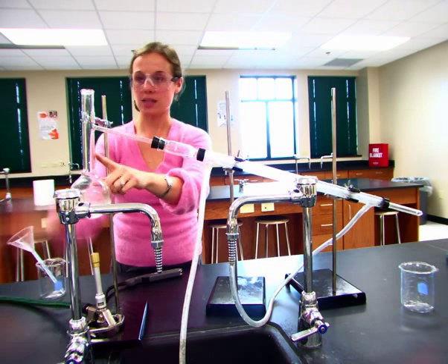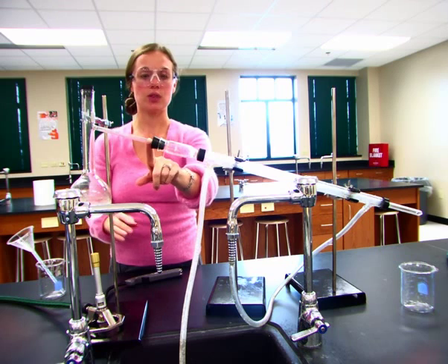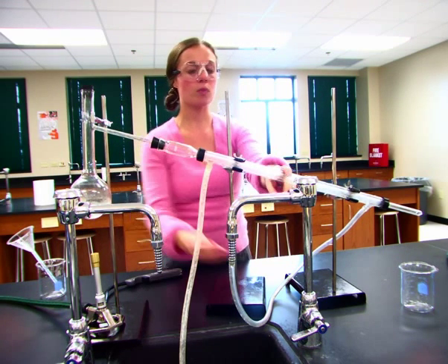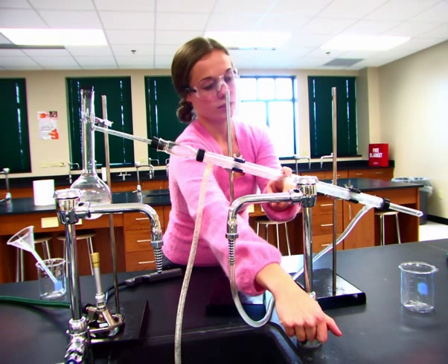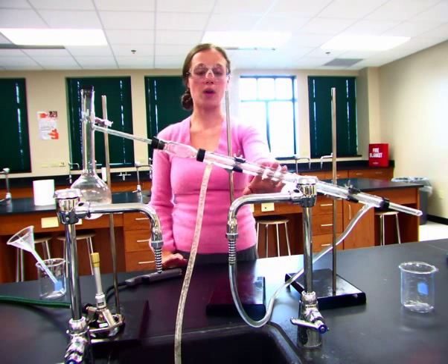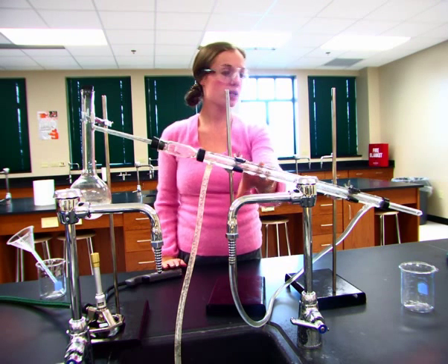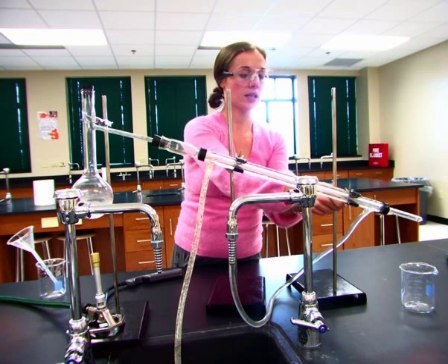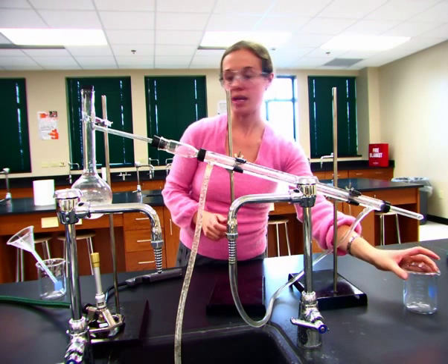It's going to form a gas, which we're going to seal in there with a stopper. The gas is then going to trickle down this tube, go through a condensing tube, which we are going to run cold water through. So just like this. So we run cold water. The cold water cools down the tube on the inside. When the gas touches that tube, it cools down, condenses, travels down the rest of the tube, and drips into our waiting beaker.